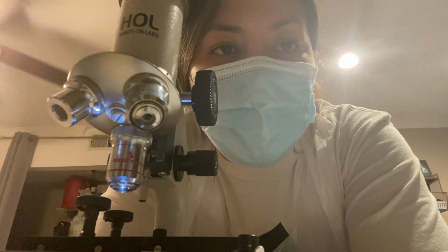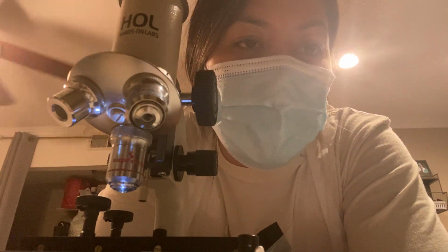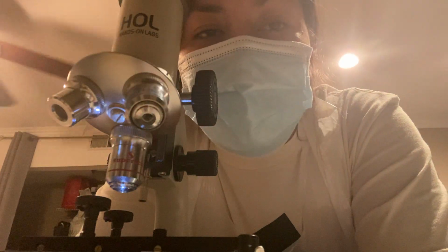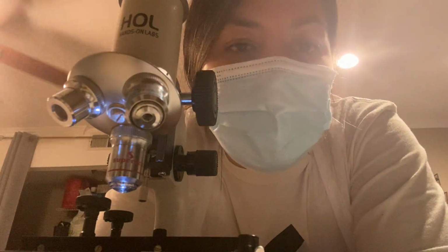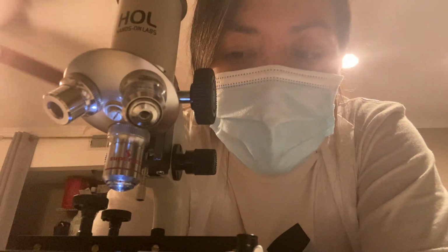I recorded the experiment part about 10 minutes ago. My slides have been prepared, and they have dried for about 10 minutes now, so they're completely dry. I have my first slide under the microscope, and I'm going to go ahead and get started and show you, or not show you, but explain to you what I'm seeing. And we'll go in order.